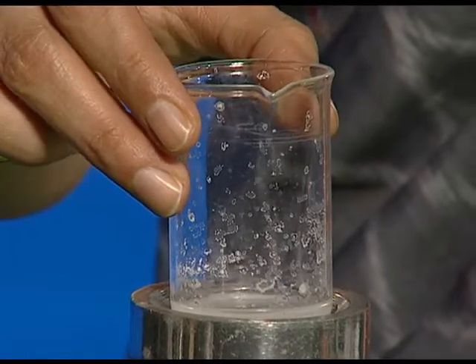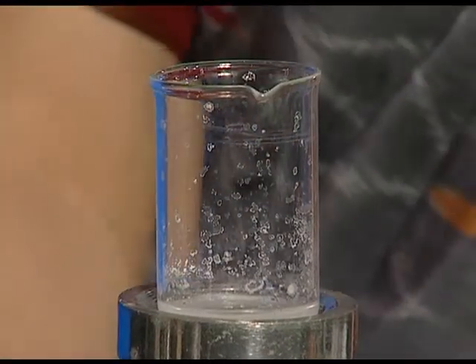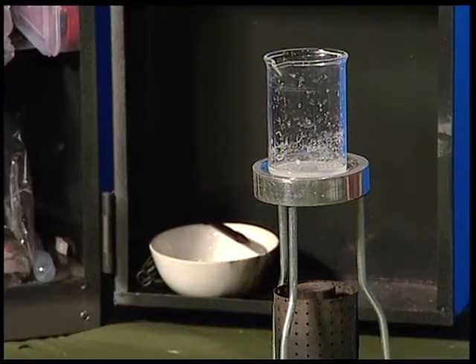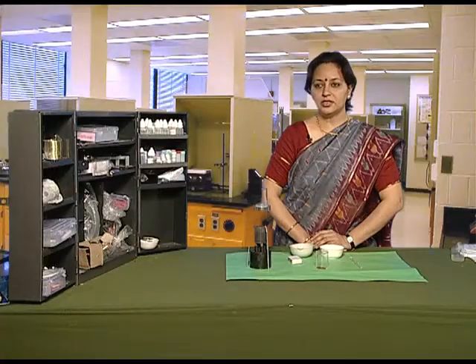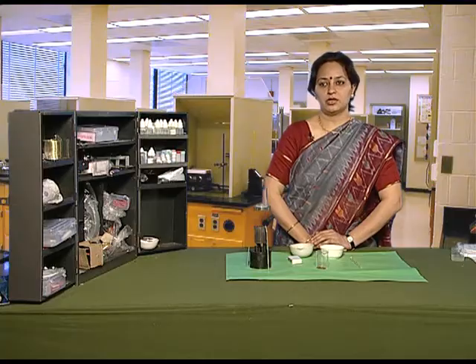In this way, we can separate a mixture of sand and salt by using water as a solvent, followed by decantation and then by evaporation.